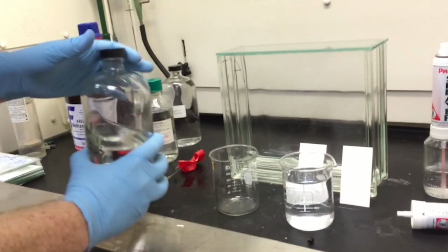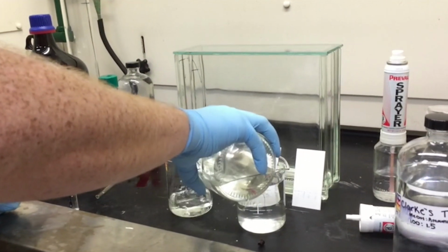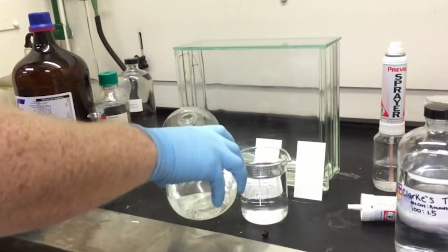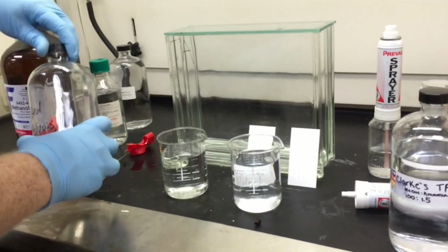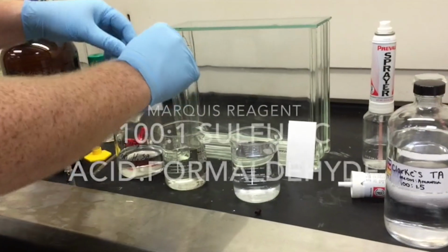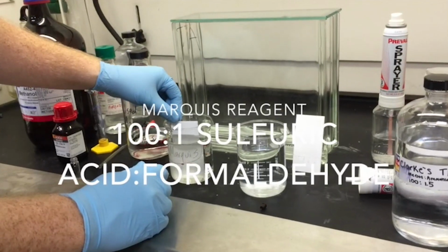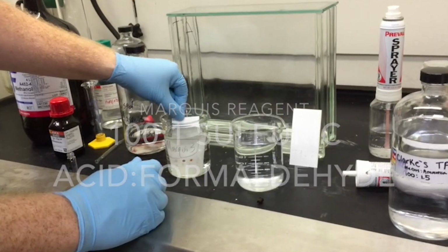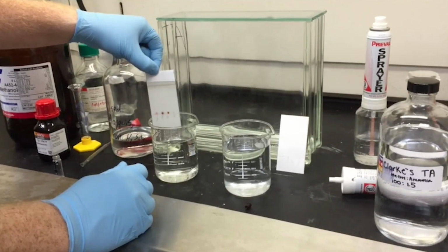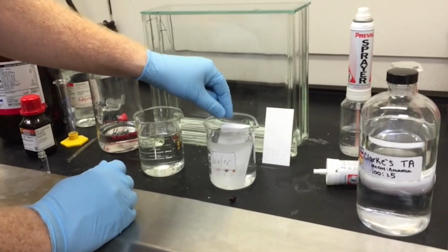You can also immerse a plate in a reagent. There's a really excellent reagent called the Marquis reagent that gives different colors for a lot of different drugs. It's quite dangerous, actually. I really should be wearing a lab coat here, and you see I've got the Marquis reagent and just some water. And when I immerse this plate, it's going to give a color indication. So that not only provides you with where the spot is, but the color of the spot can give you some information about the identity of the molecule. Sometimes it depends on the drug. So you can use color tests on TLC plates as well.